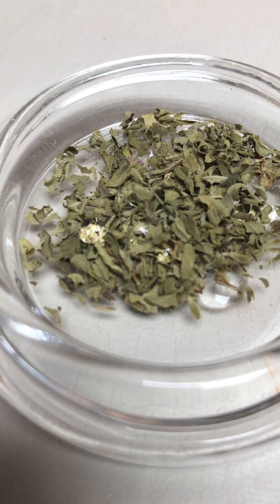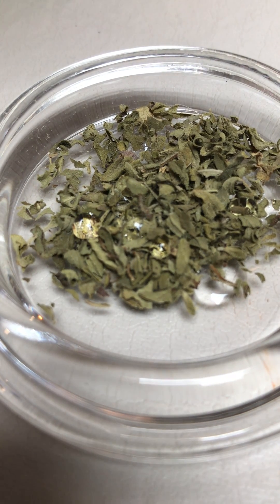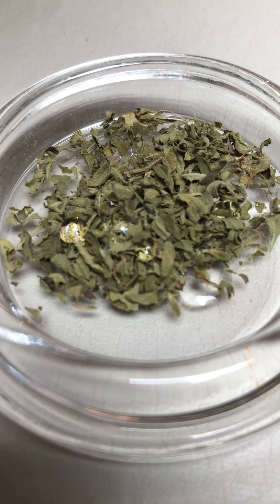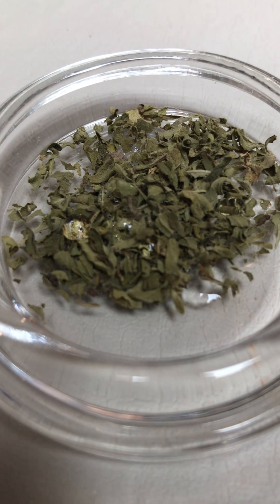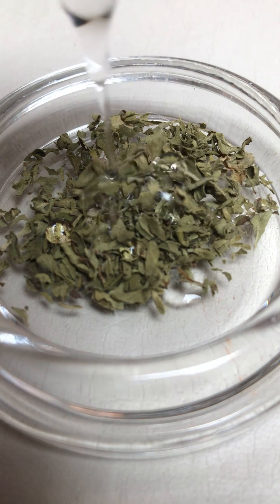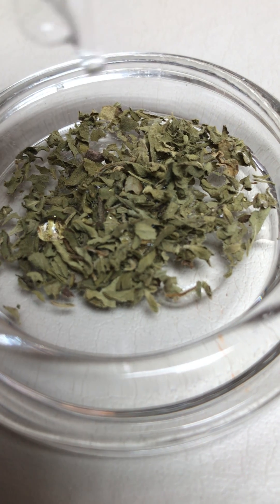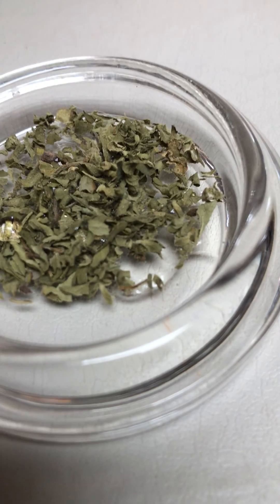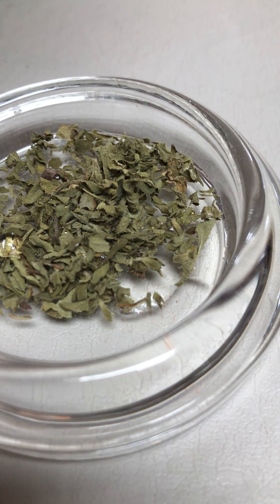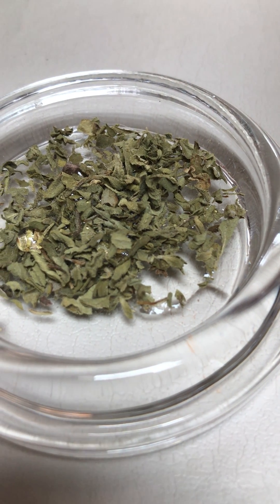And if you look closely you can actually see a little bit of fizz going on. Put some more on there. See some more — drop it all over. There you go. So if we look closely you can see just a very tiny, slight fizz on some of the leaves.